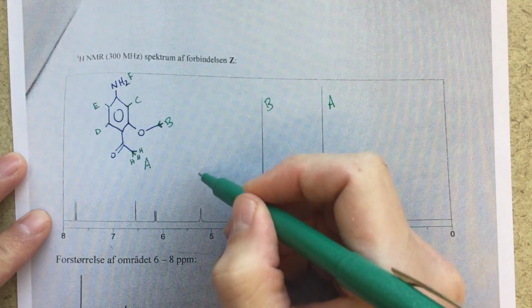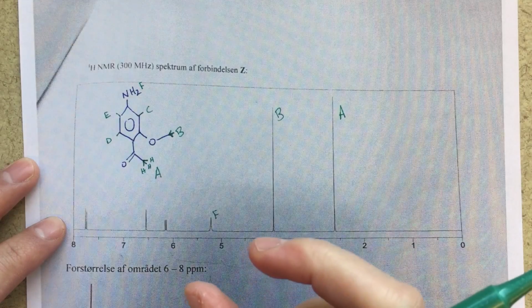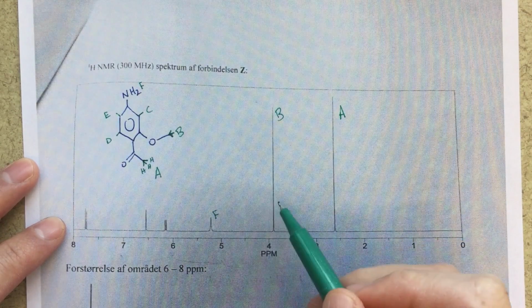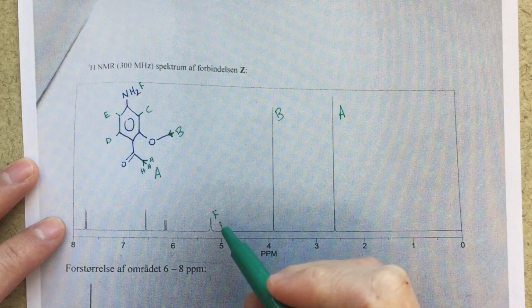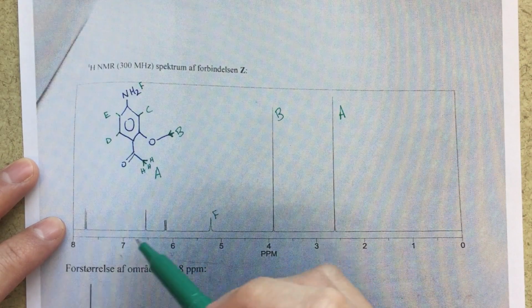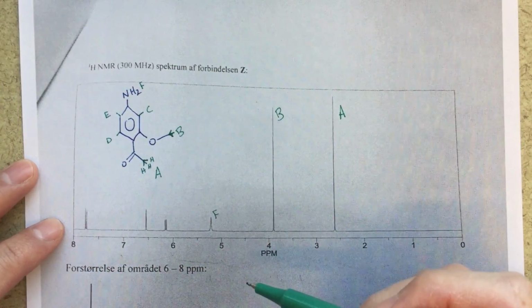But I want to talk about this peak here. So I know that this is going to be the peak for F. And I've got a variety of reasons for saying that. I think probably the best reason is that it's a little bit broad. So to me, because it's broadened, that suggests that this would be an integration of 2 high, which is a little bit crazy, right? This is just so much taller, but because this is broadened a little bit, the integration is the whole area. So this, I think, is pretty clearly going to be my NH2 peak. It's also in the middle here. It's not really in the aromatic region. I figured this would be more aromatic region. This is somewhere in between, from where we see our CH3 groups here. So I think that's pretty clearly F.